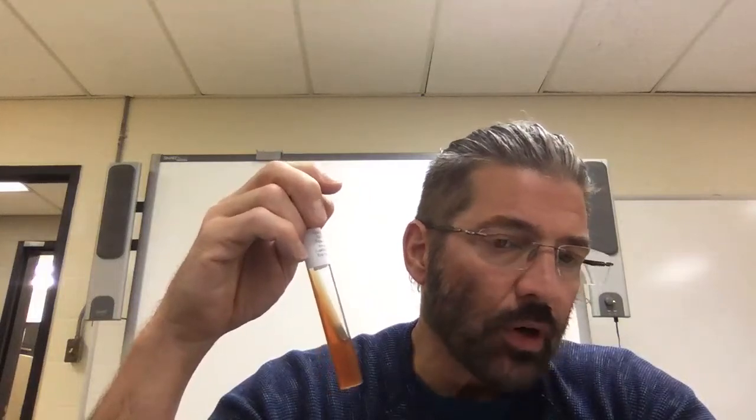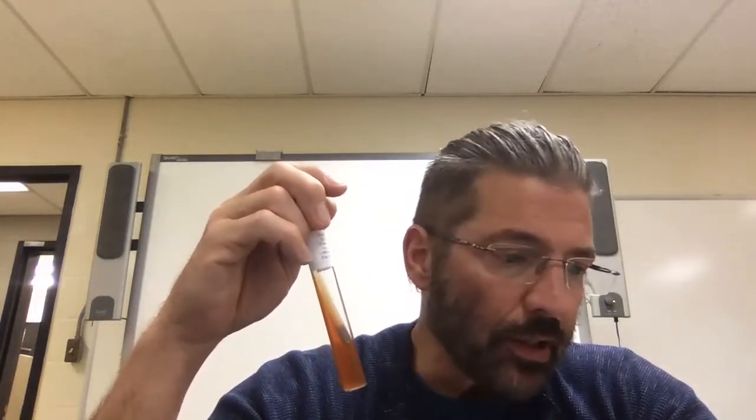These cultures were literally 24 hours old when we inoculated them. They've been in the incubator for almost exactly 24 hours. I pulled them out, so now they're at room temperature. Remember, yellow is due to acid production. Red is going to be for a higher pH.